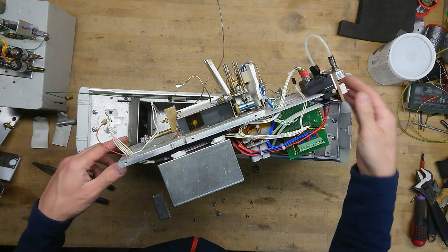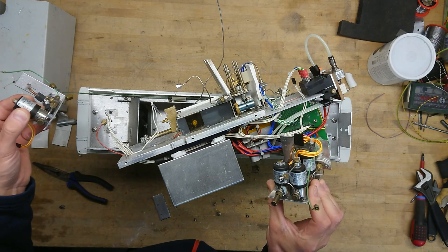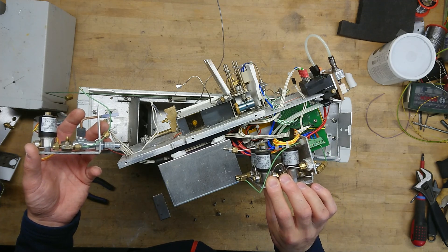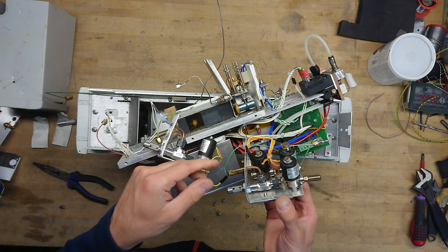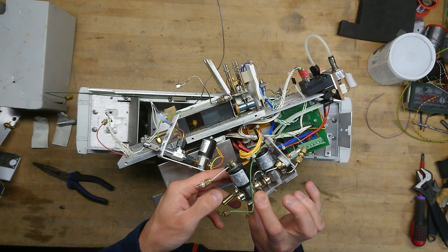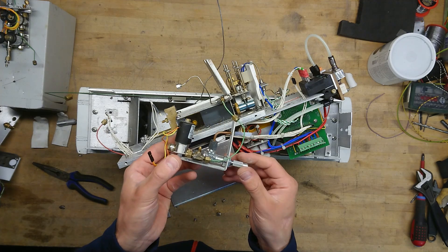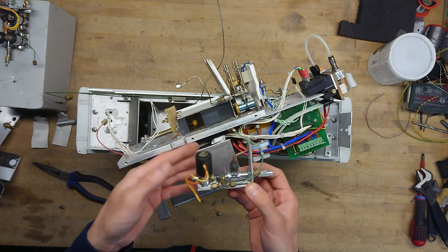And all of a sudden, this whole assembly just popped out of the box — just look at that. From picking out these very small Precision Dynamics Incorporated 24-volt DC valves — it says orifice 0.3, that must be inches I guess. There are small tubes and pipes running between them, but also some small manual T-piece valves here. Really high quality, expensive parts. This I can for sure reuse for some kind of very special setup. I do have a dream of playing with some gases to do some controlled flames, though maybe this is just too small for that.